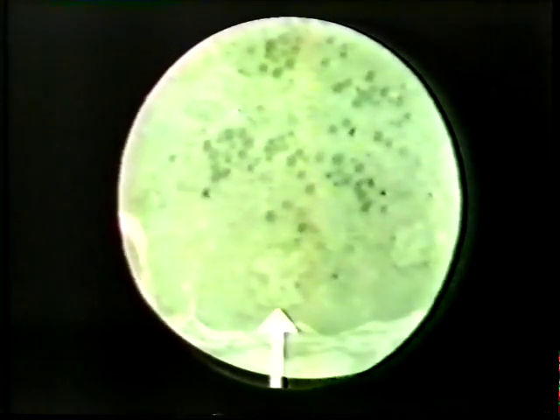And this is it, a real live image of the section at a magnification of about 4000. But to the untrained eye, it's a bit disappointing. It's hard to make out what things are. At the bottom, the light area is actually connective tissue, and above this is the triangular-shaped pancreatic acinar cell. This is the nucleus. These could be secretory granules.